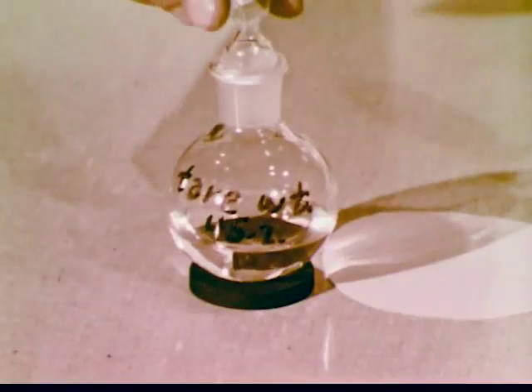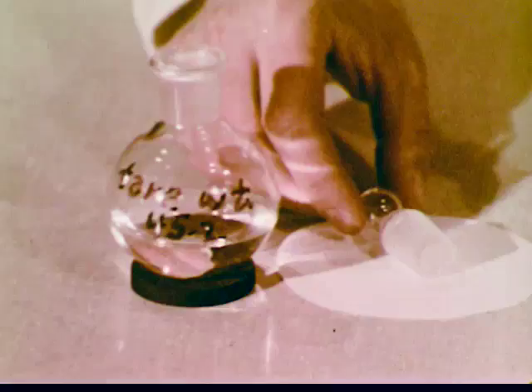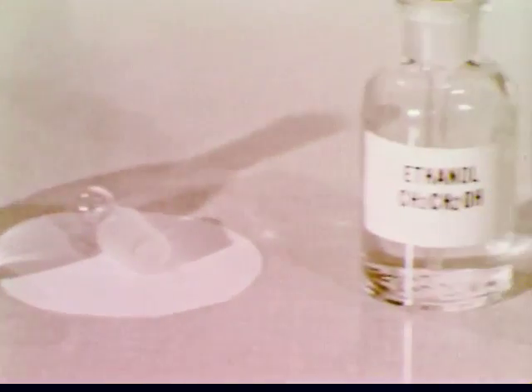This is a reasonably good result. Yields as good as or better than this can often be obtained if one is careful in controlling the conditions of the reaction and in isolating and purifying the product. How is the identity of the purified product confirmed?